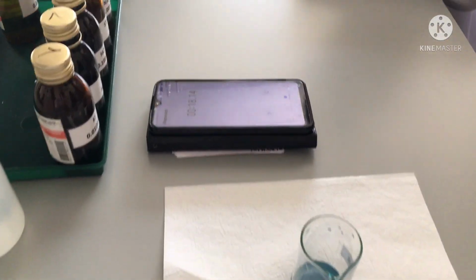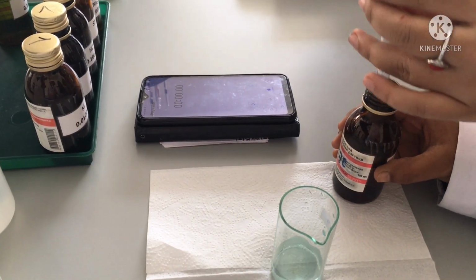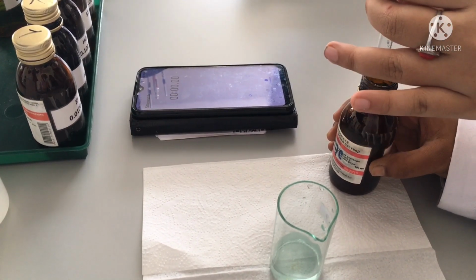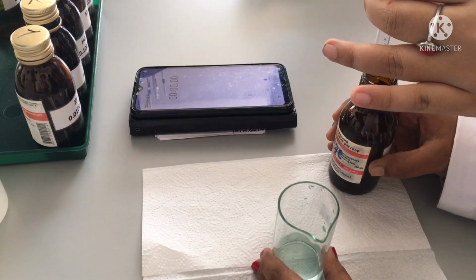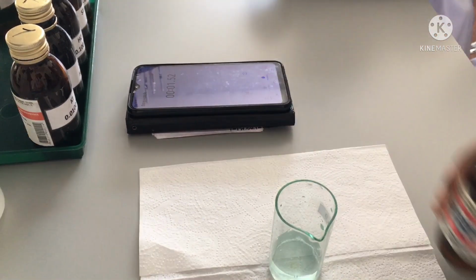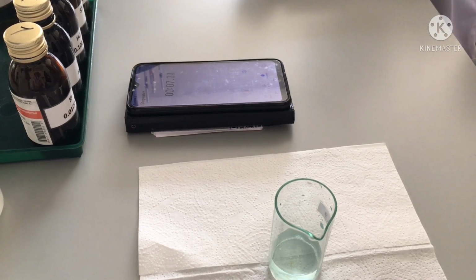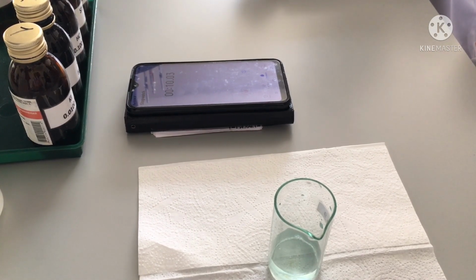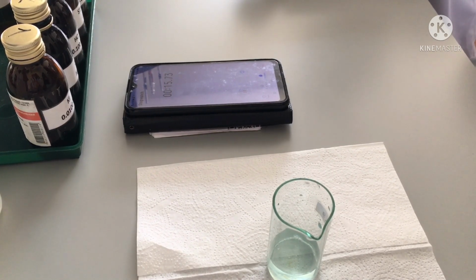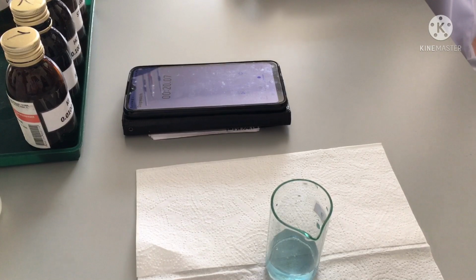Ma'am, can we do the finalization? Yes, if you prepared everything, you can add. This is number 2, yes? Yeah. Yes, if you prepared everything, you can add. How much? 3. Everything is 3. 3, 9. You need 7.